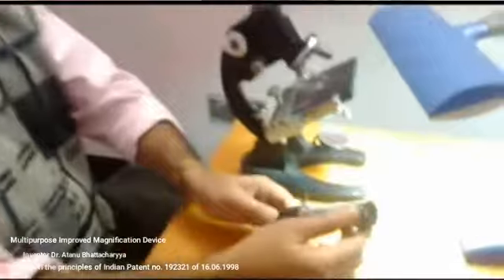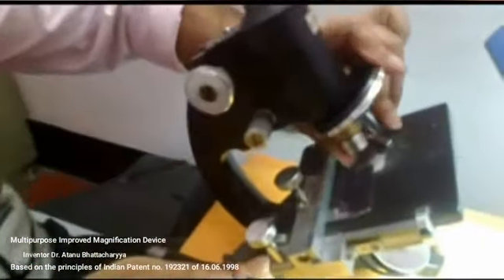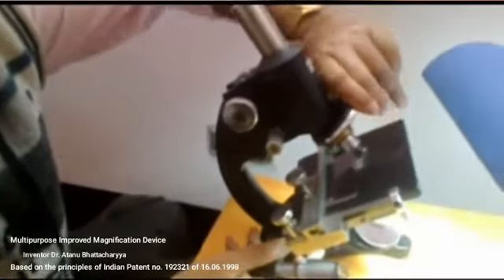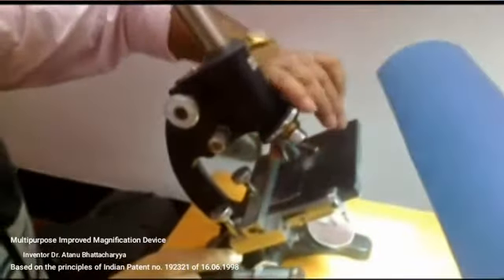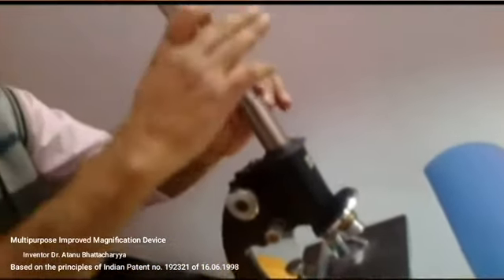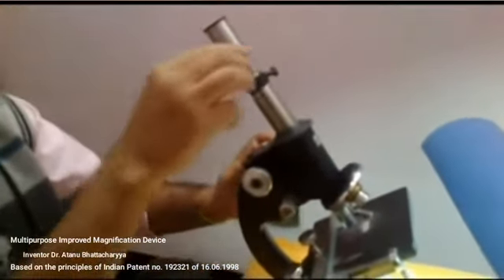Now look at the device again. Here it is written 10x, and there is written 5. So if I push the T1 tube into the T2 tube and the graduation mark 5 touches the end portion of the T2 tube, and now here if I use the 10x objective, because here is written 10x and here it is written 5, after using the 10x objective, if I keep the tube here and if I adjust it, then 50 times magnification is achieved.